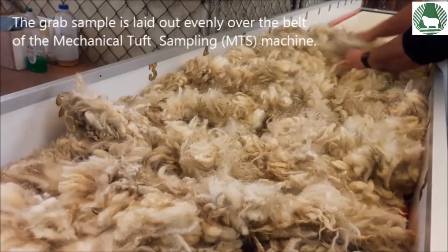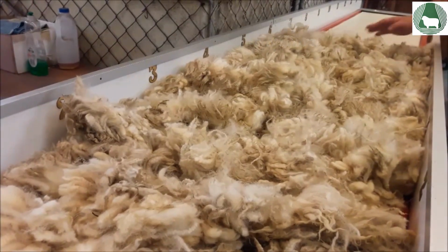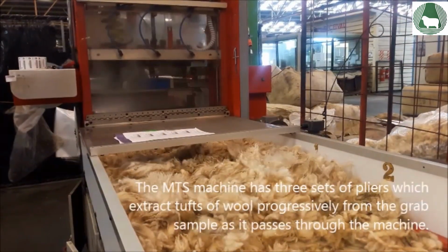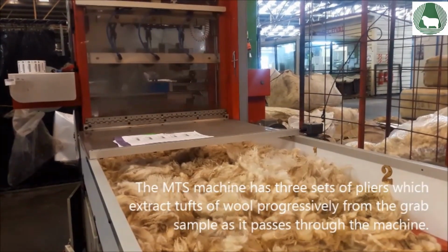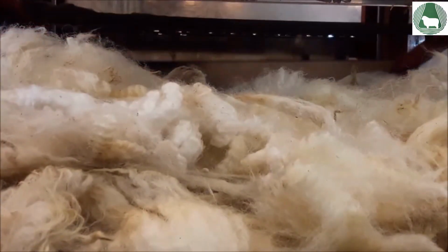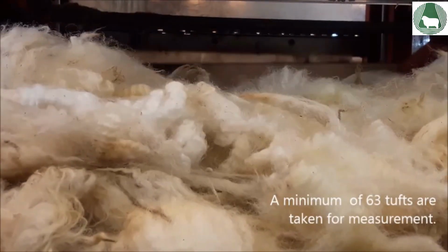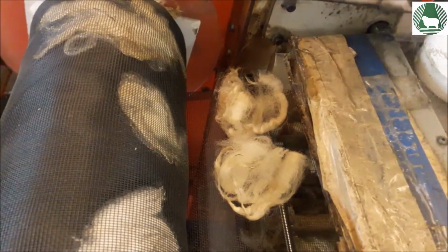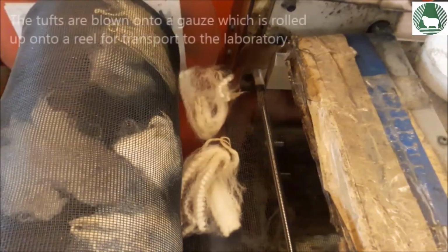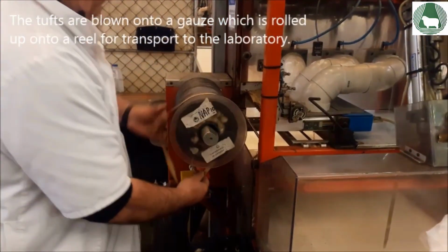The grab sample is laid out evenly over the belt of the mechanical tuft sampling machine. The MTS machine has 3 sets of pliers, which extract tufts of wool progressively from the grab sample as it passes through the machine. A minimum of 63 tufts are taken for measurement. The tufts are blown onto a gauze which is rolled up onto a reel for transport to the laboratory.